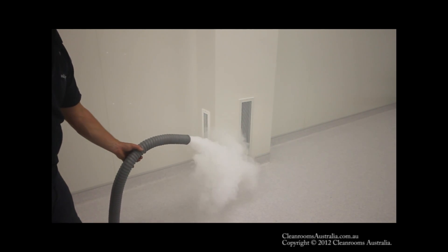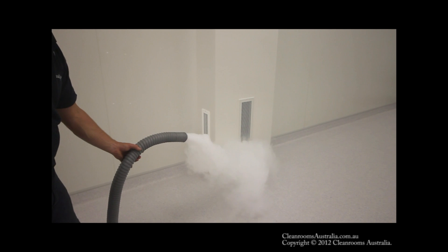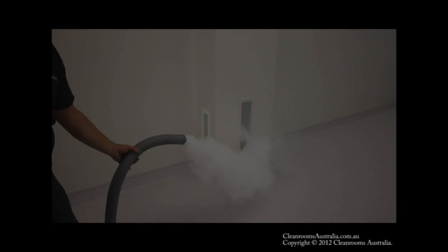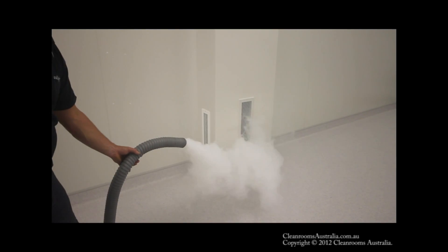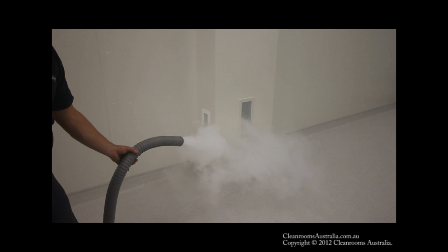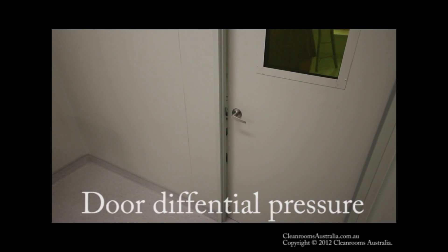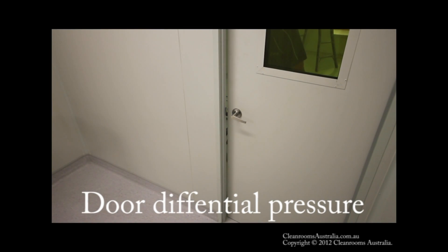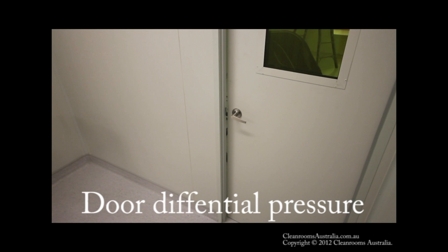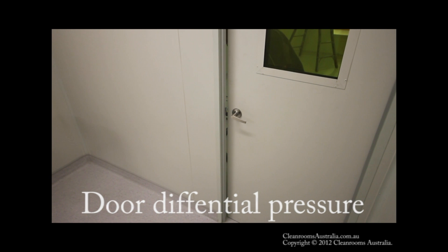It's also very important to use a smoke with a large enough particle size to get caught in the primary filters, so as not to affect the secondary or HEPA filters with the density of the smoke in the filter itself.